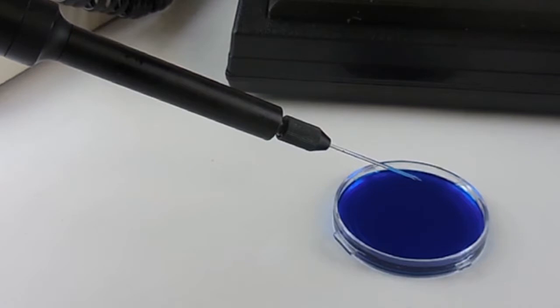Once you have filled the micropipette with the injection liquid, your pipette is ready to do the injections. You can now set the parameters of the volume and rate on the Micro 2T or the standard controller that you want to inject. And that is the process to fill a micropipette to use with the nanoliter injector.